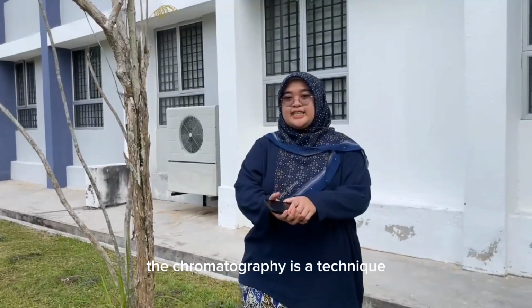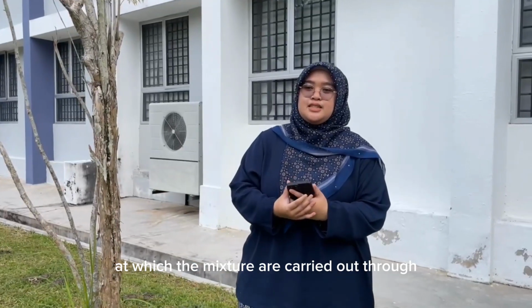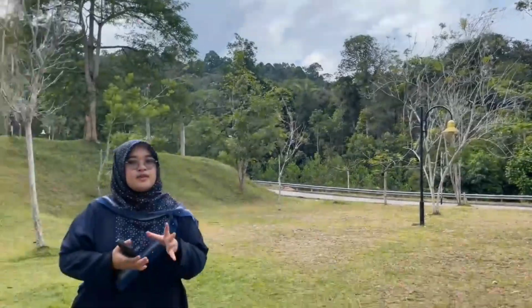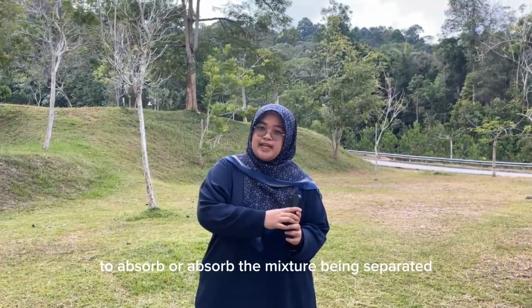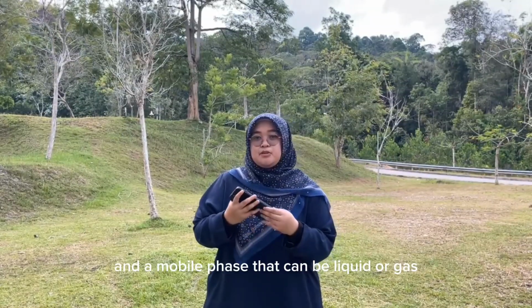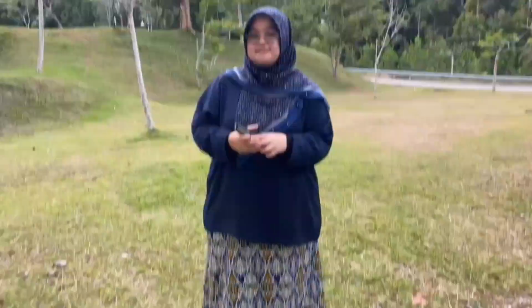Chromatography is a technique used to separate the components of a mixture based on the differences in the rates at which the mixture is carried through a stationary phase by the flow of a mobile phase. All types of chromatography contain a stationary phase that can be solid or liquid, to absorb the mixture being separated, and a mobile phase that can be liquid or gas, which passes over the stationary phase and carries the components.